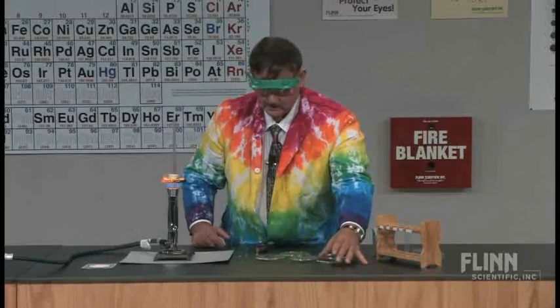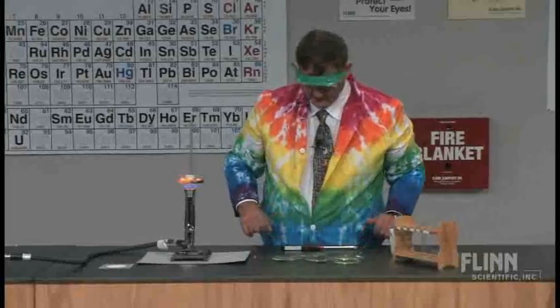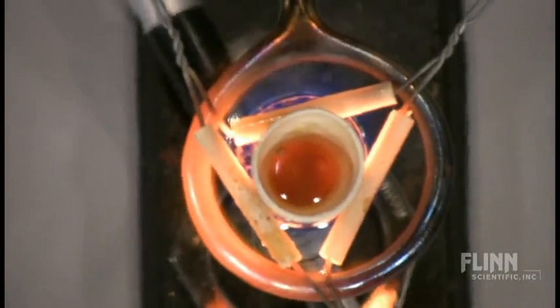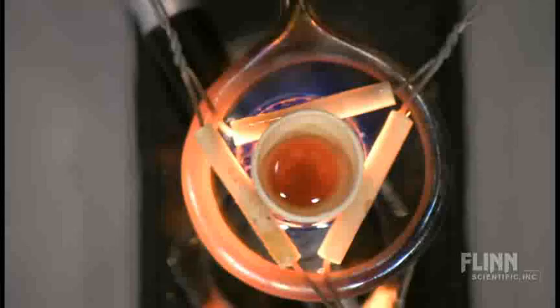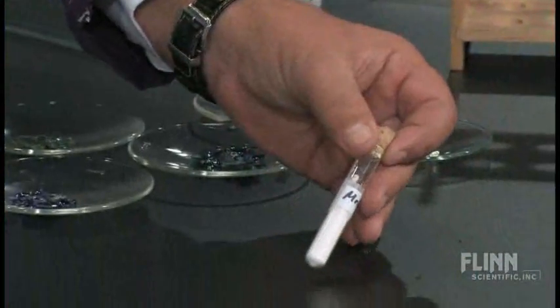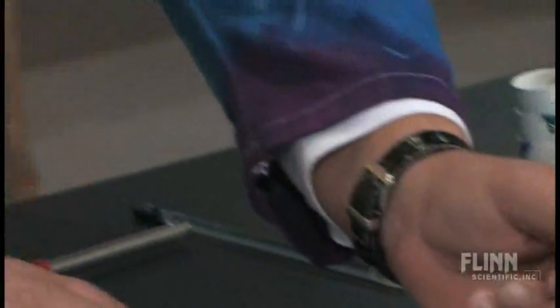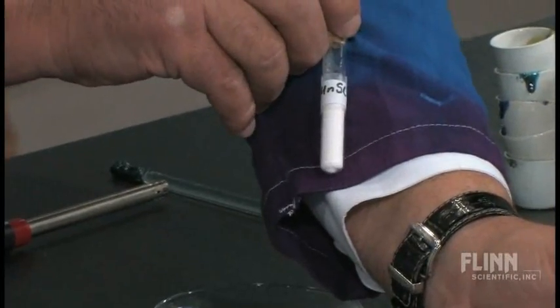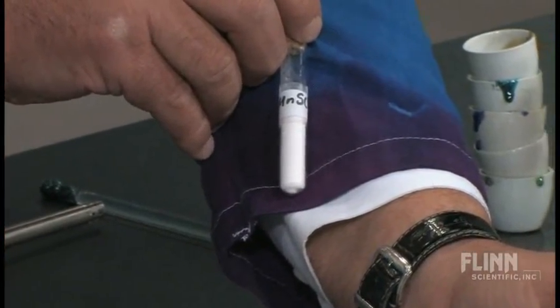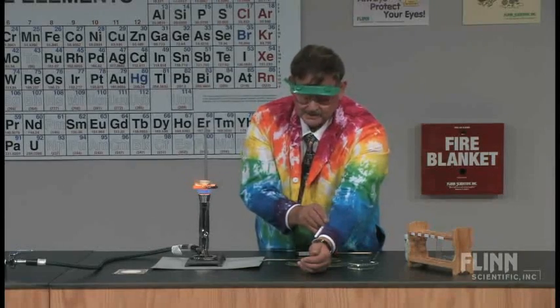All right. Okay. It looks like my molten glass is almost done. So I have a small test tube of manganese(II) sulfate, which I don't know if you can see the color, but maybe if I hold it up against the blue part of my lab coat, you can see that it has kind of a pink tint to it. All right. It's not really white. It has more of a pink tint to it.